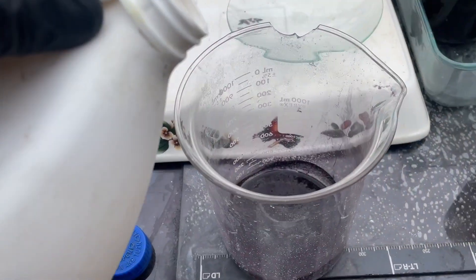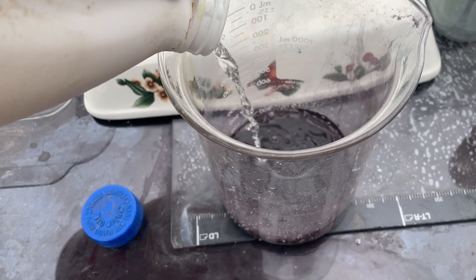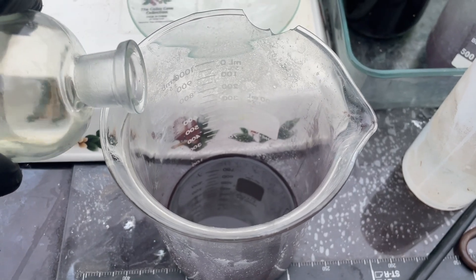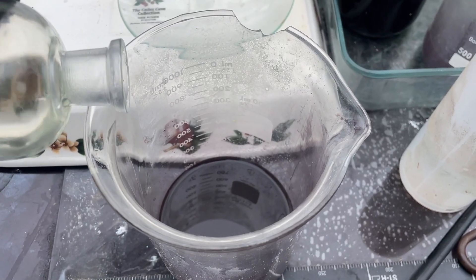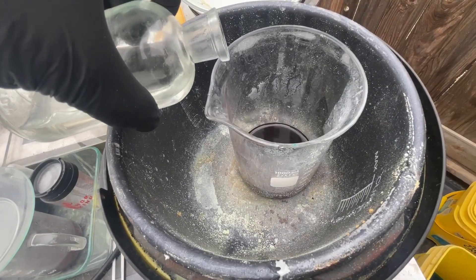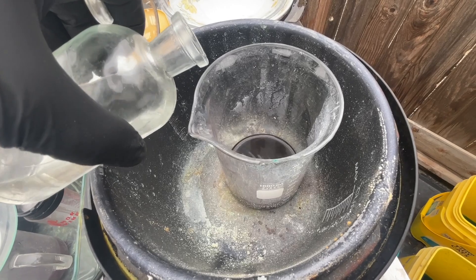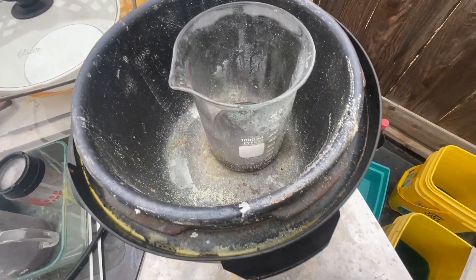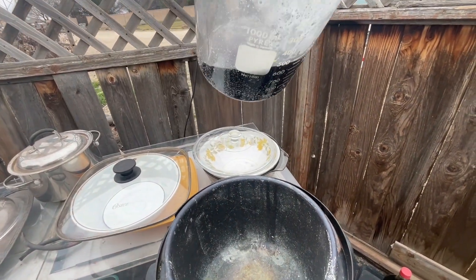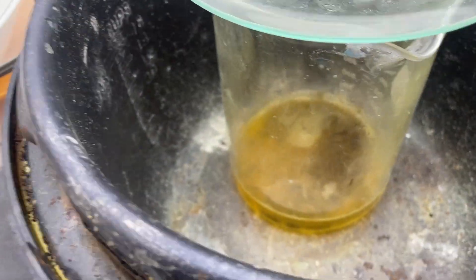I'm going to use a little bit of hydrochloric acid here. I'll add a bit of water in there — that's okay — going about 100 milliliters. Now a bit of concentrated nitric acid — just a little bit, not much. And a little bit of sulfuric acid — got to be very careful with this stuff — just a little squirt. That should be enough. What that'll do is hopefully precipitate out the lead.